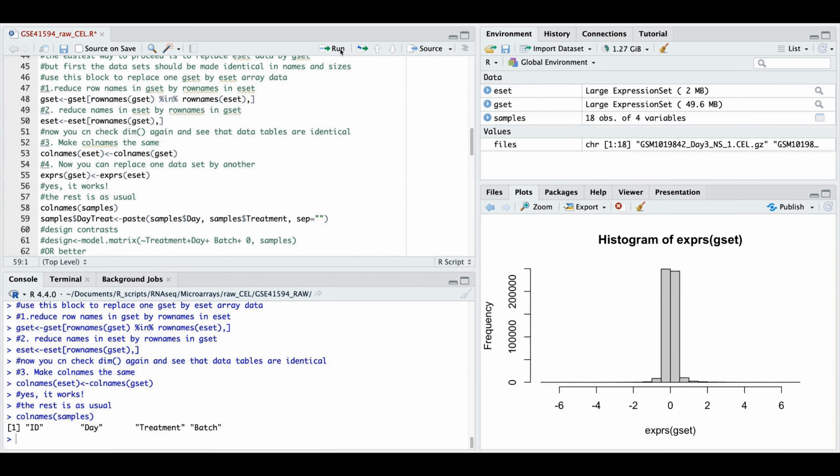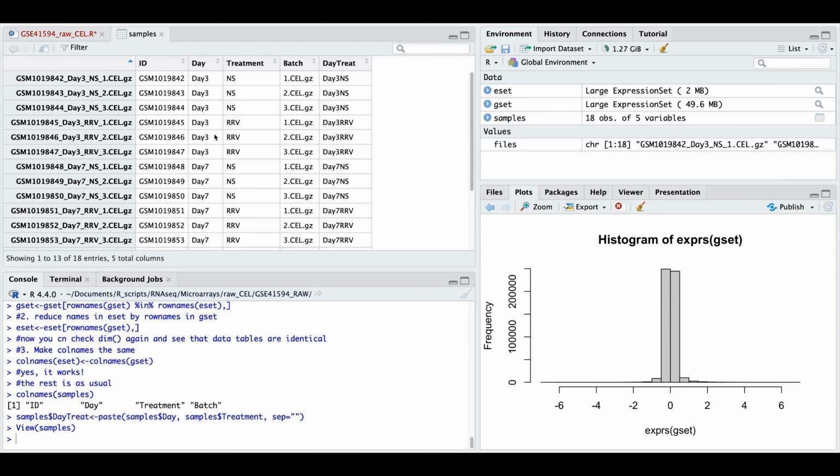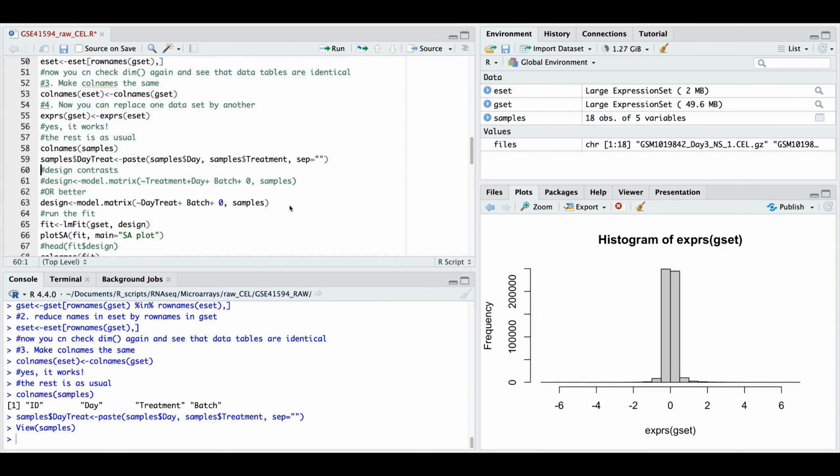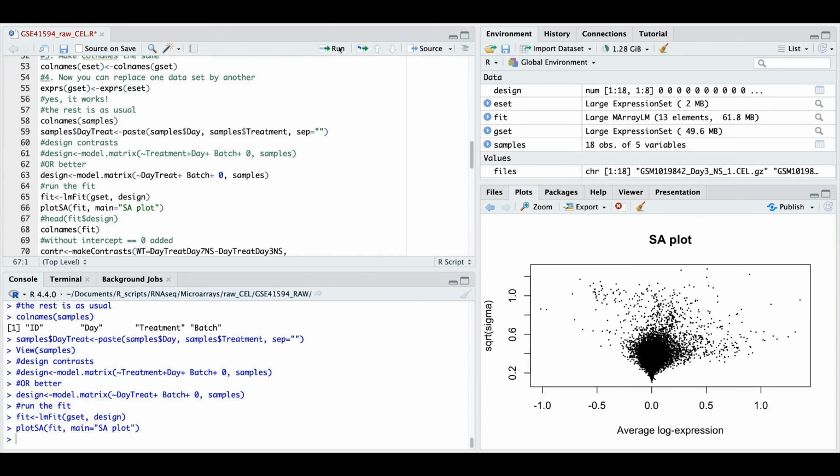And in addition, we add day and treatment column to simplify our design wishes. So it's simply converting 2 factors into 1 factor, after which we have a day treat, like day 3 control, day 3 virus, 7 control, 7 virus, and so on. Now we say the design will be 1 factor of this composite day treatment. No, 2 factors plus batch and 0. Then we run lmFit and then plotSA.